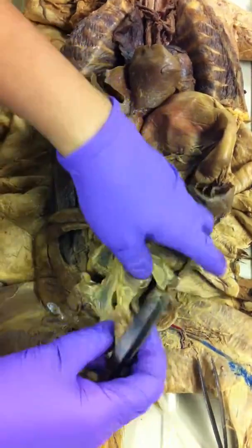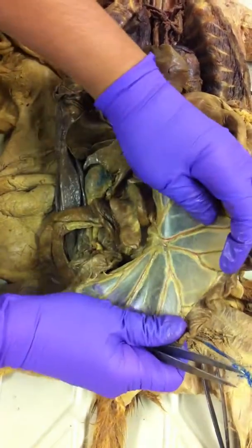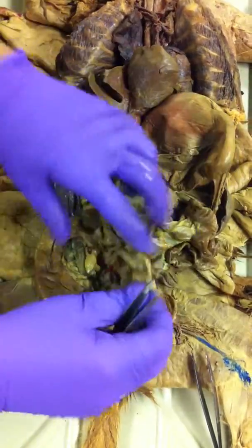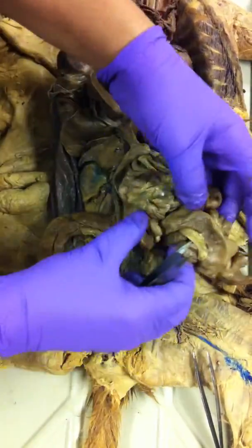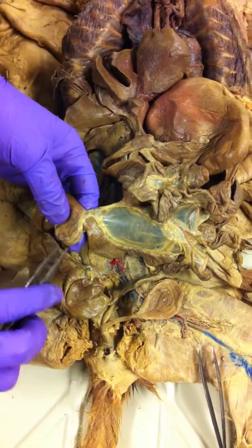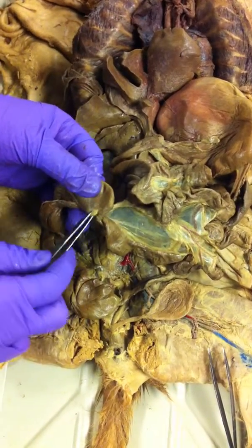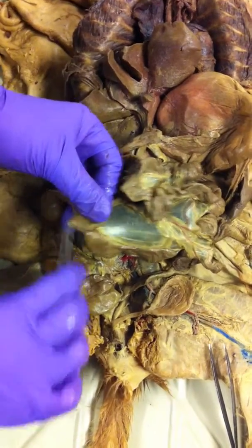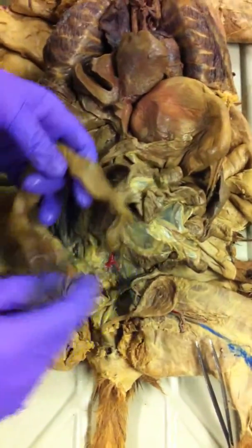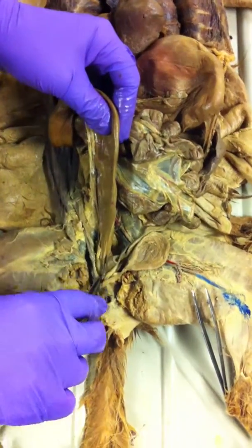This is your rest of the small intestine, and this is called the mesentery of the small intestine, which suspends the small intestine from the posterior abdominal wall. The small intestine, and more specifically the ileum, opens into the cecum. The cecum, and I'm thinking this is your appendix. You can have different positions. That's the cecum, that's your colon, emptying into the rectum. Okay?